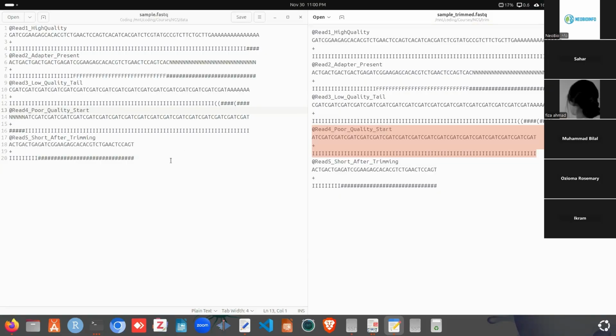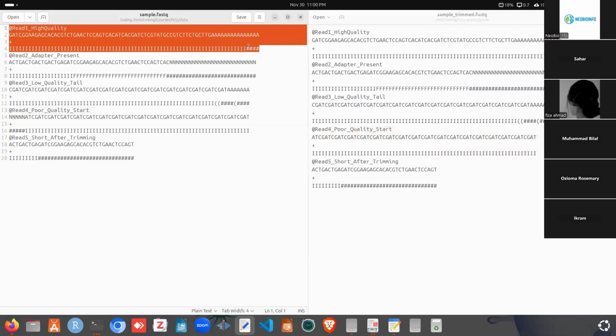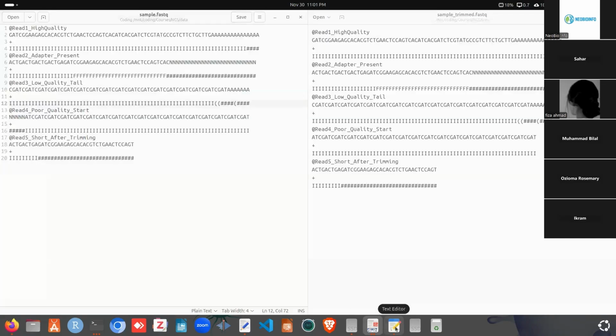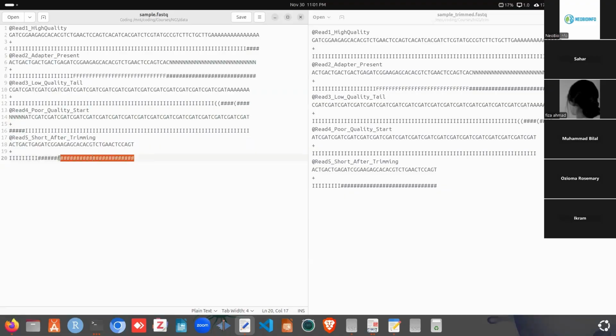For the TRAILING command, we can see the same thing. The LEADING command works left to right. The TRAILING command works right to left. So we will see an effect for read 1. That is, we won't see these bases, and also not this one, and it will start from here, and when it gets the first bracket sign, we can check the score of the first bracket sign. Here is the first bracket sign. It has the quality score 7. So 7 is greater than 3, so it won't remove it. It will start from here and stop at this position. It won't have any effect on read 4. And for read 5, it will trim this.